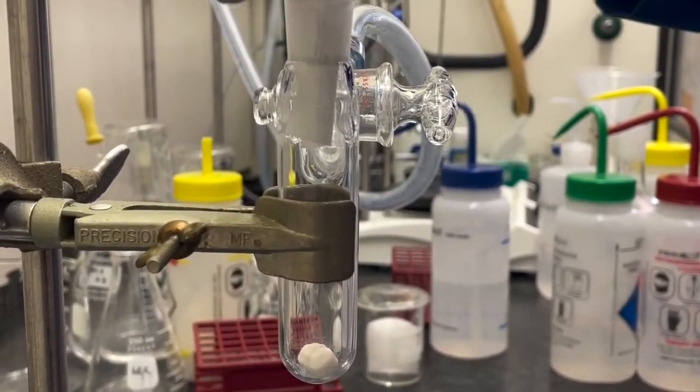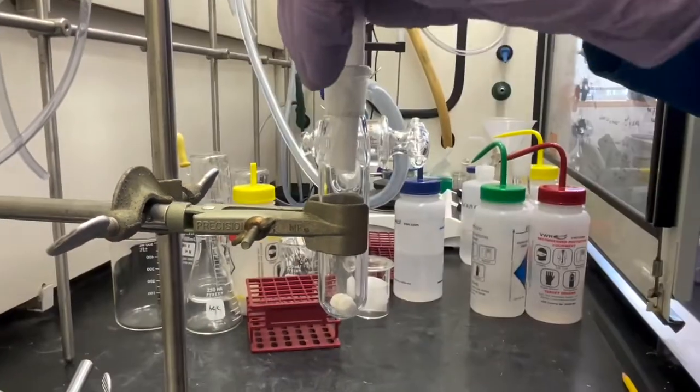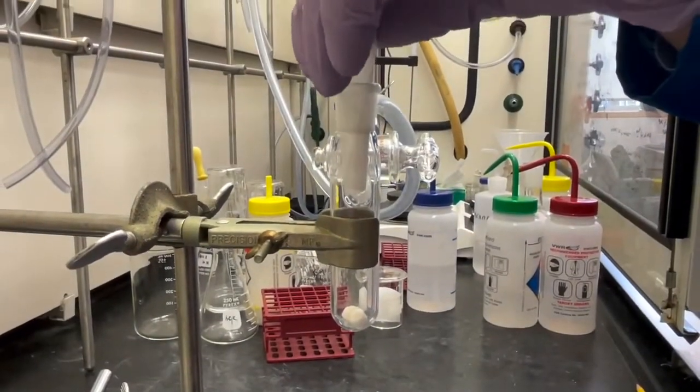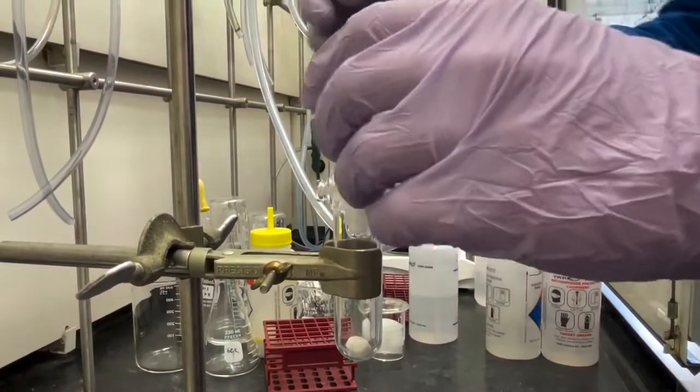Solids are added to the reaction through a cone while nitrogen flows in through the sidearm, preventing moisture from entering the reaction flask.